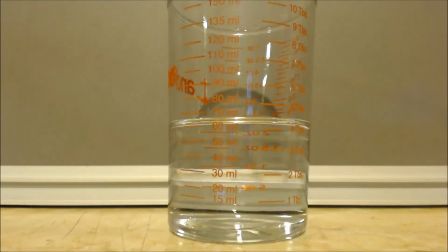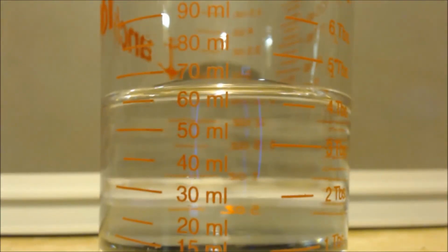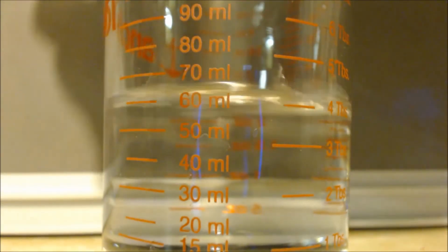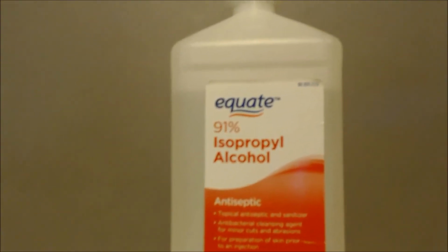Alright, well there's what I got. You can see it's crystal clear. Almost 70 milliliters. Figure around 10 milliliters was water. I took it all the way down to 70, and I still have a little bit in here that would take it up to exactly 70 now that I see it. So it lost a little bit, but it's definitely anhydrous. Always remember, science is great.